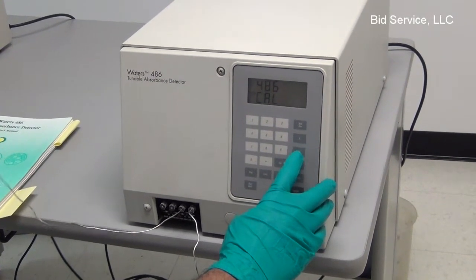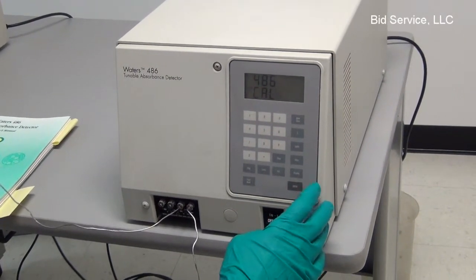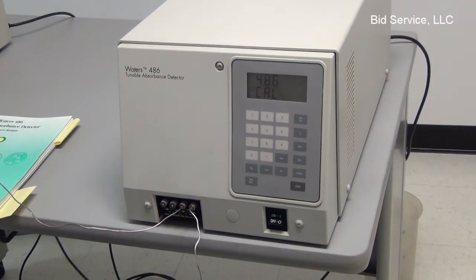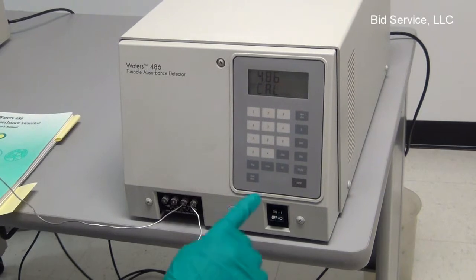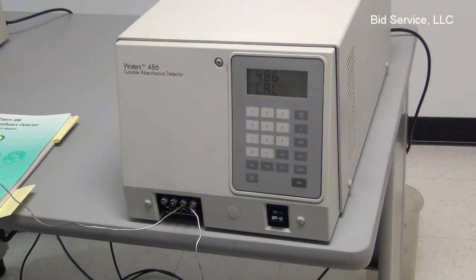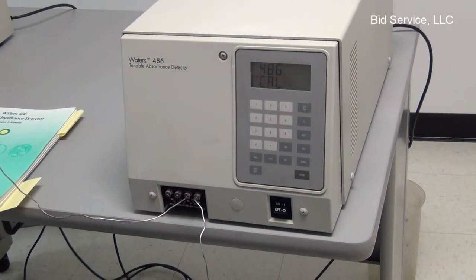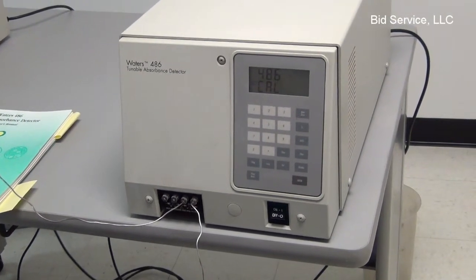This is AUFS — the absorption unit full-scale display. There is also a diagnostics key to enter various diagnostics modes of the machine. The polarity on the analog output can be reversed using the polarity key. The lamp key can be used to turn the lamp on and off. There is also a key for chart marks and display, and the filter key enables adjustment of the signal-to-noise ratio.